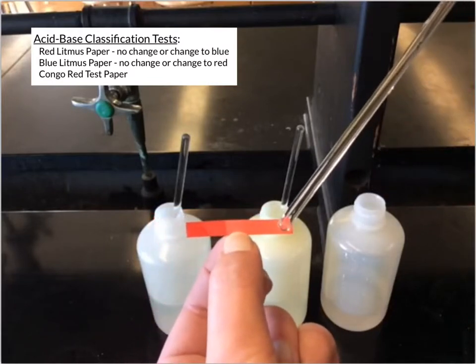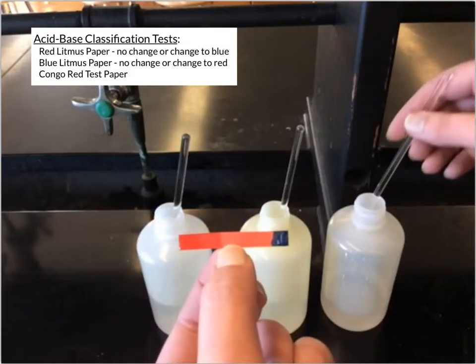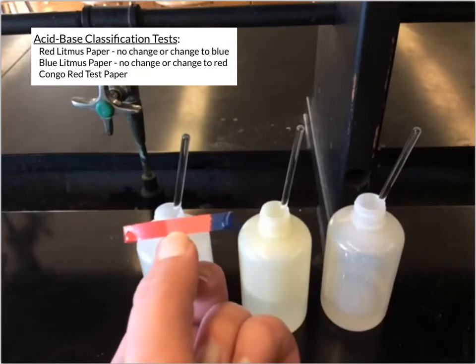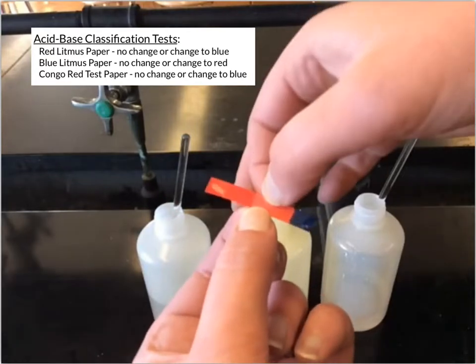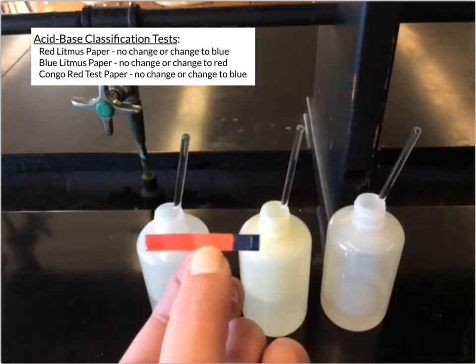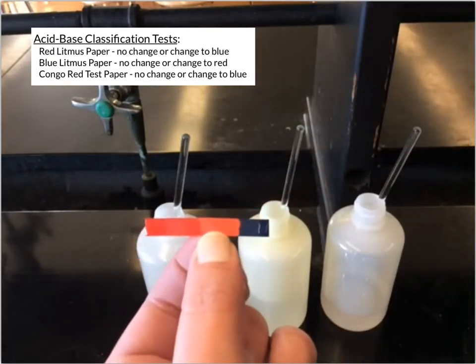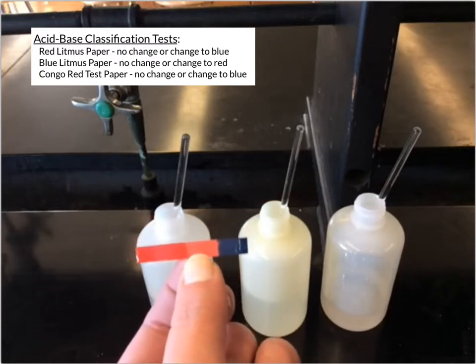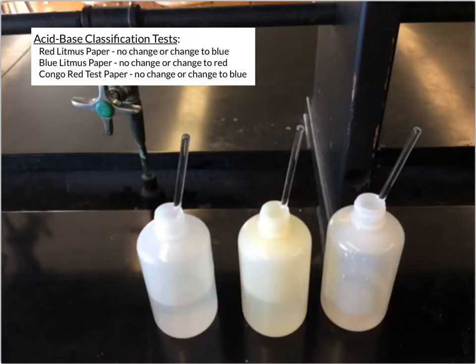But if I test it with another substance, it could cause it to change blue. And so that's what you would see with Congo red, is that that Congo red test paper will either have no change with the substance, or it will turn blue. And that again depends on the properties of the substances. And specifically, you use these types of papers to understand acid-base type characteristics of the substances.